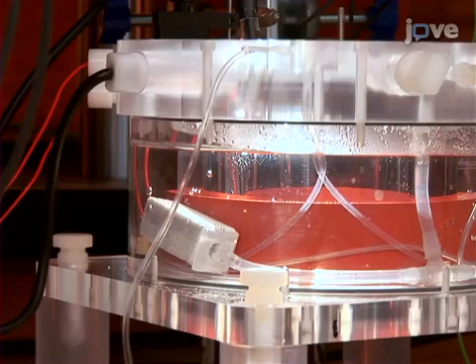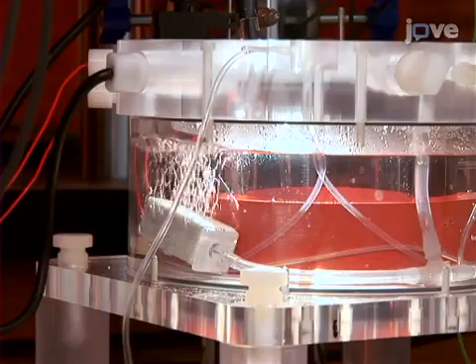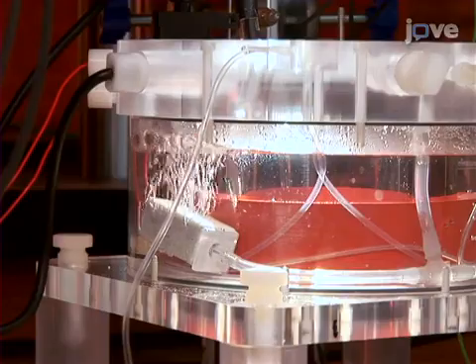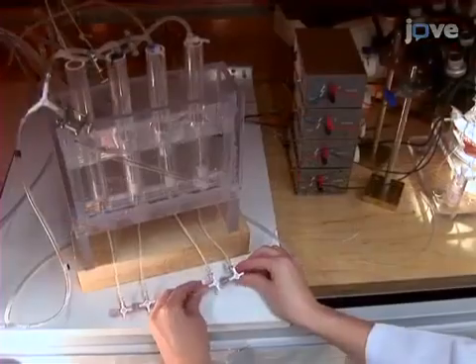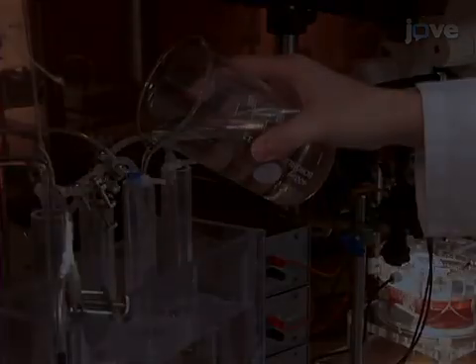The carbogen is delivered to the water bath below the recording chamber through air diffusers. Next, control the flow rate in the water bath by a flow meter. Afterward, drain the circuit and fill it up with filtered ACSF.